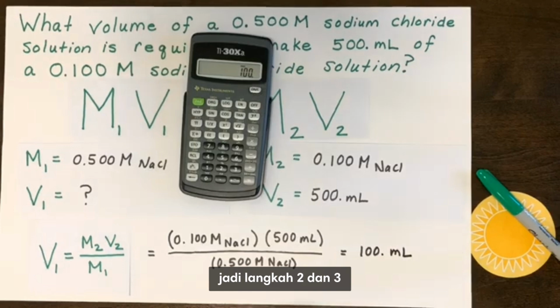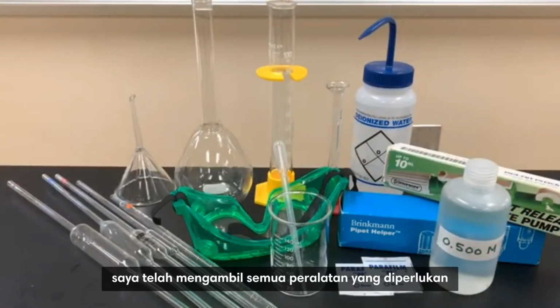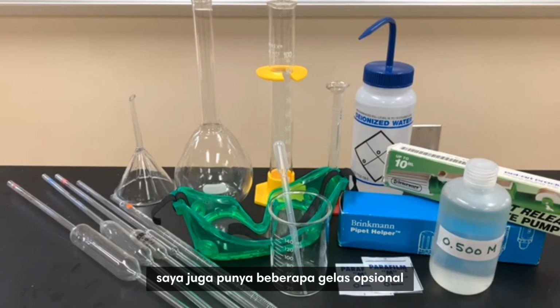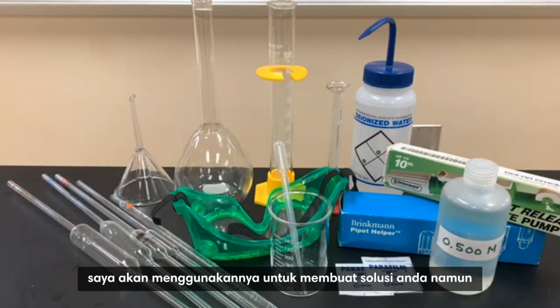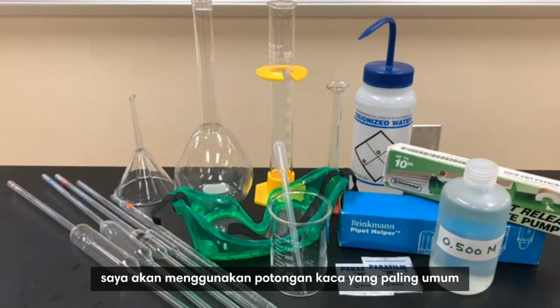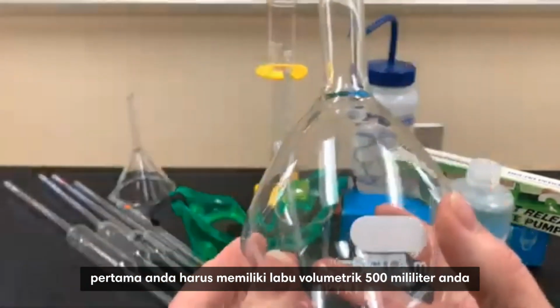So steps 2 and 3 are going to be grabbing the equipment that you need. I've grabbed all the necessary equipment we can use to make a solution by dilution. I also have some optional glassware that is more accurate, and if you have it in your lab, I would use it to make your solution. However, in this video, I'm going to be using the most common pieces of glassware you would have in a high school chemistry lab. First, you must have your 500 milliliter volumetric flask.